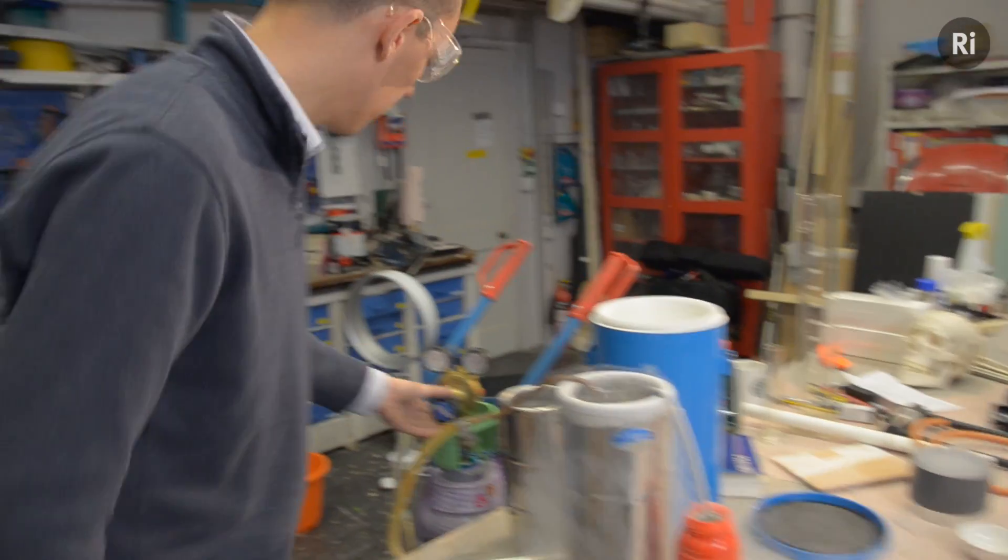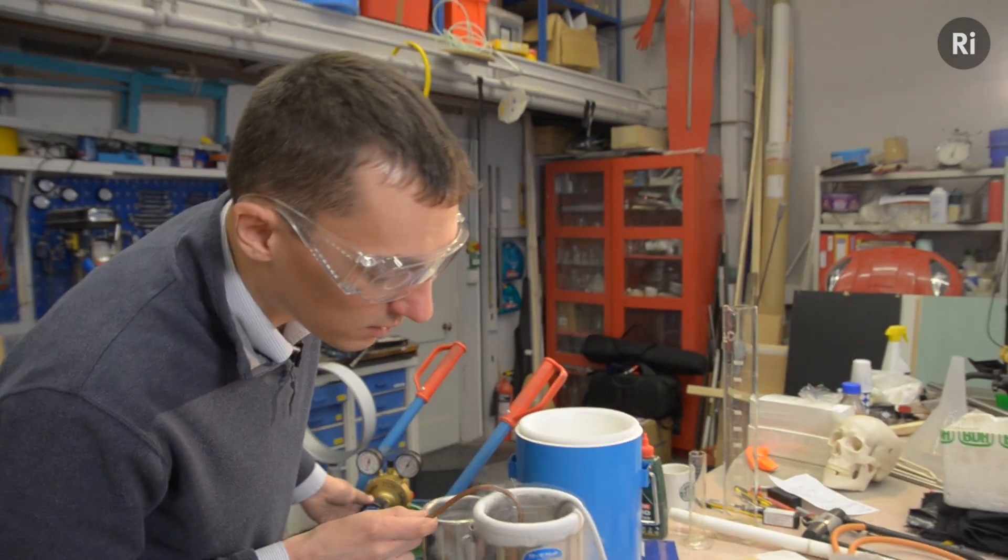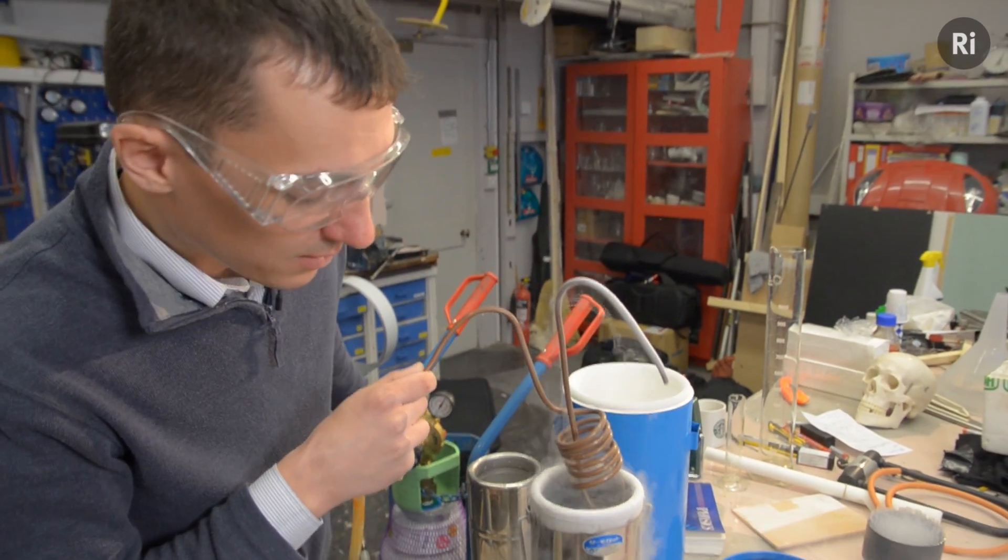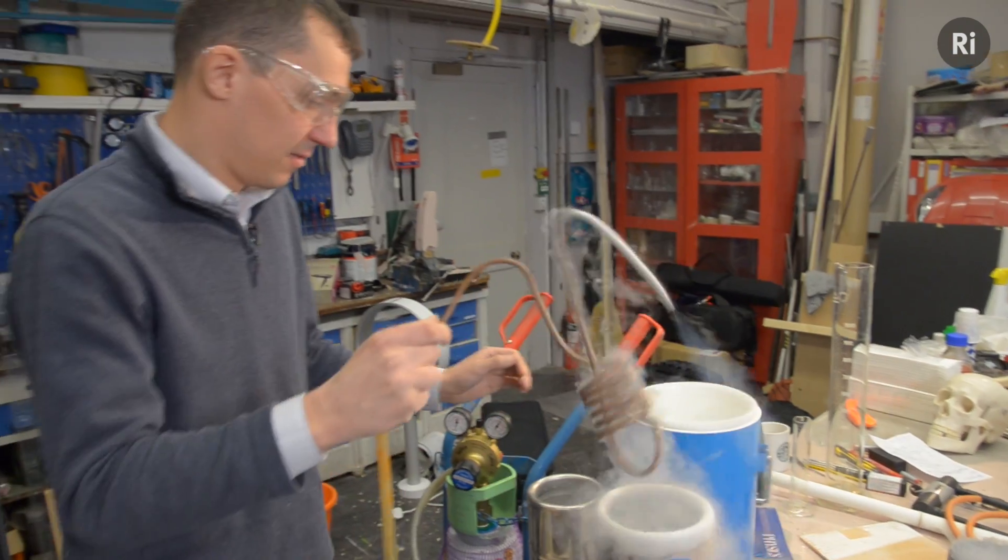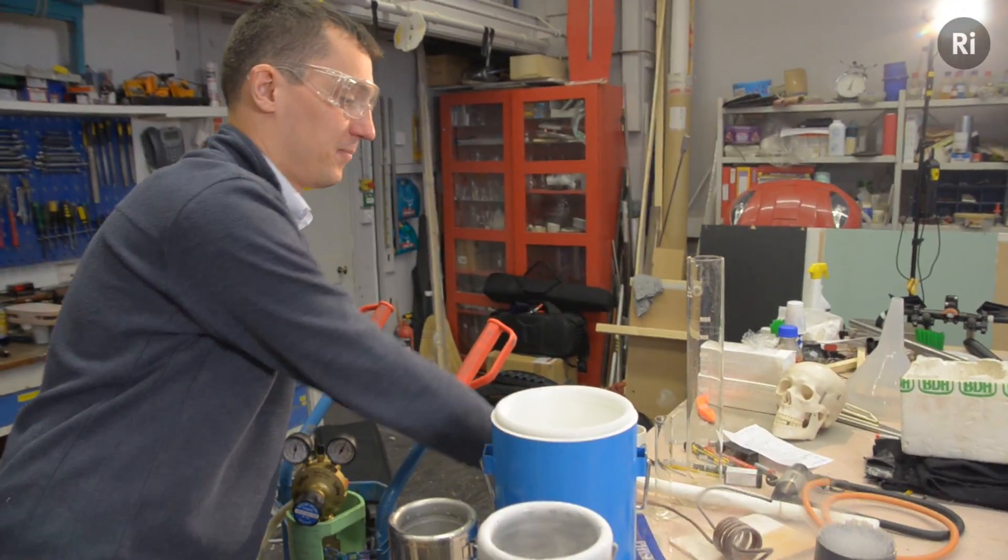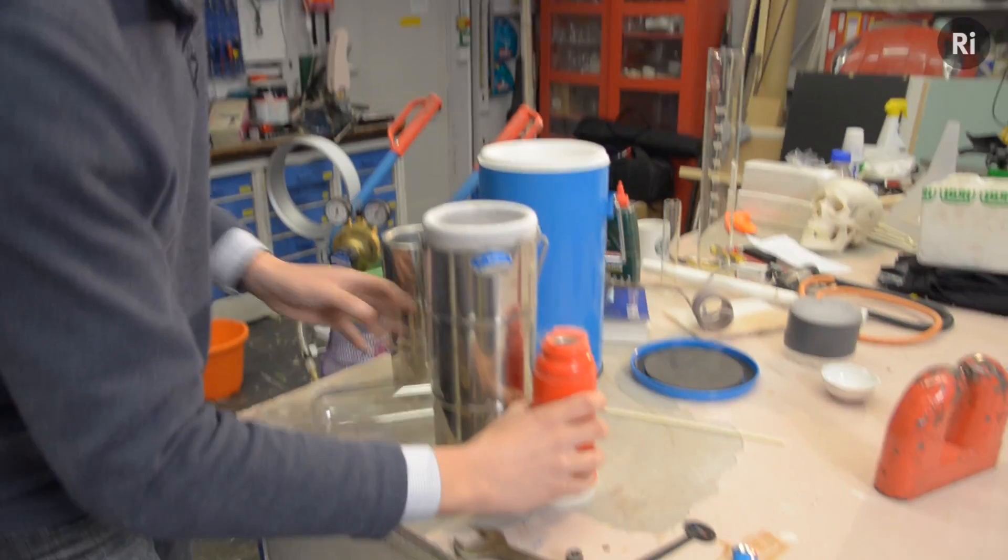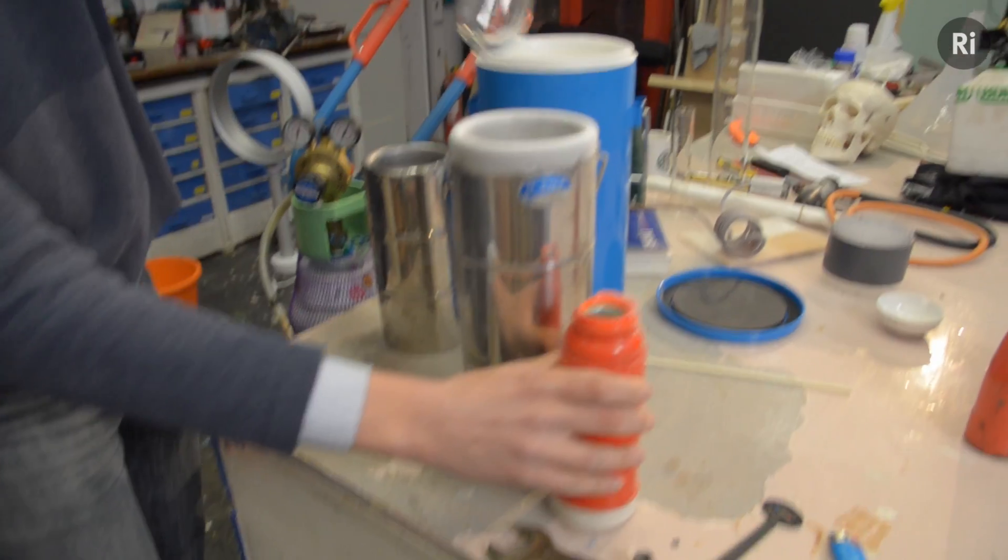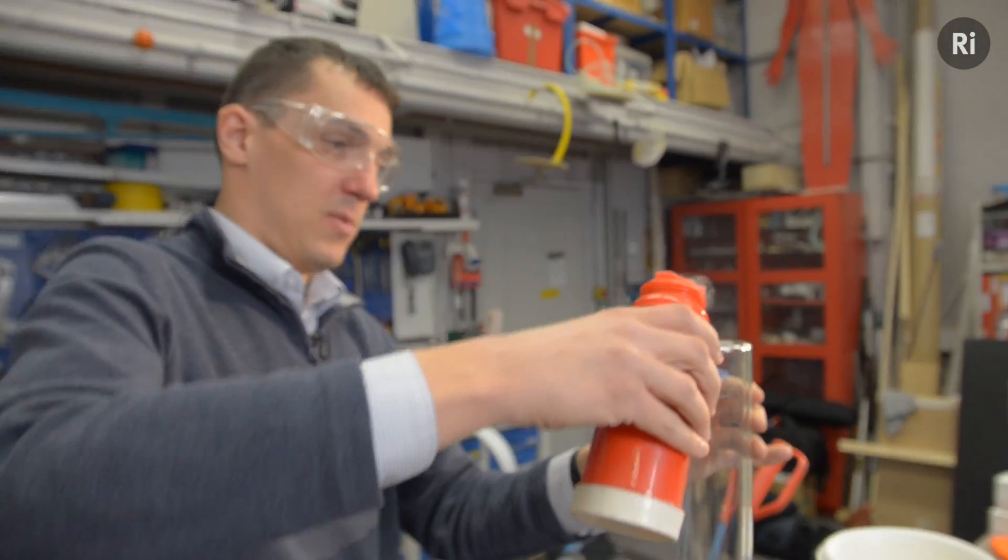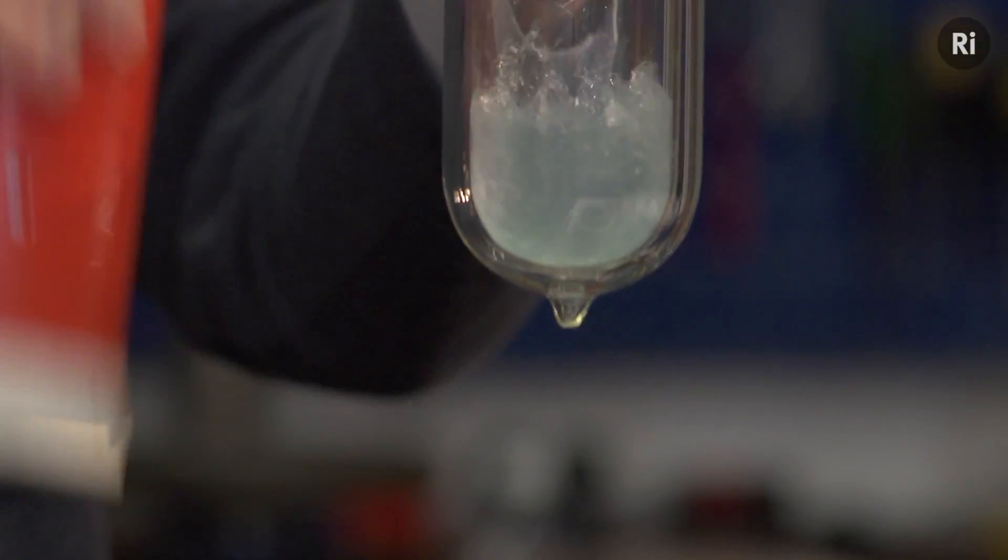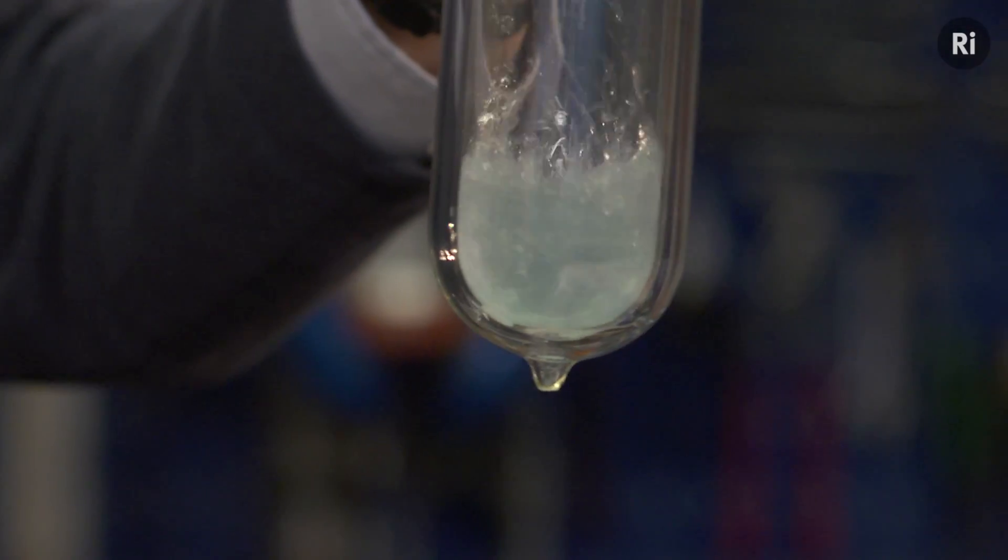So this has been going a while, I've nearly got a full tube. That's pretty full, so I'll just put this down over here. So a good half liter of liquid oxygen here. I'll just show you what it looks like. There you go, that's liquid oxygen.